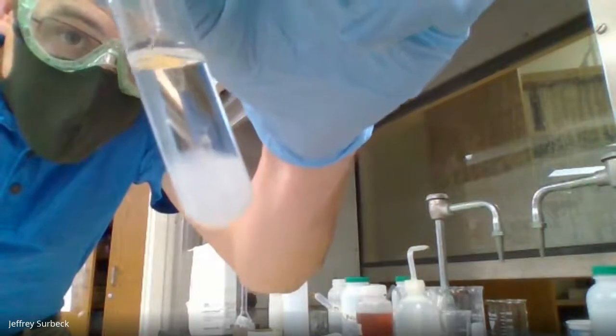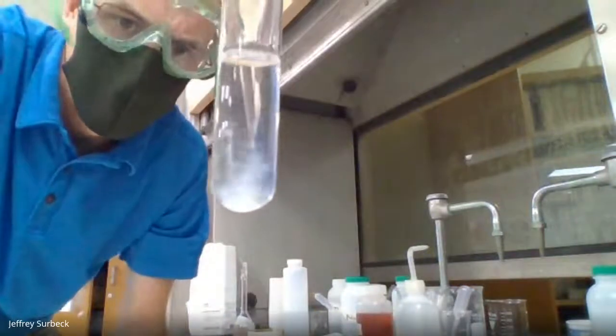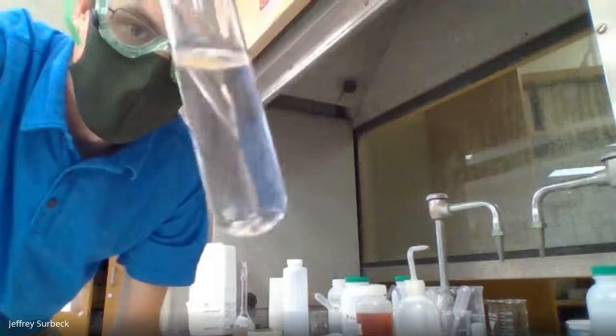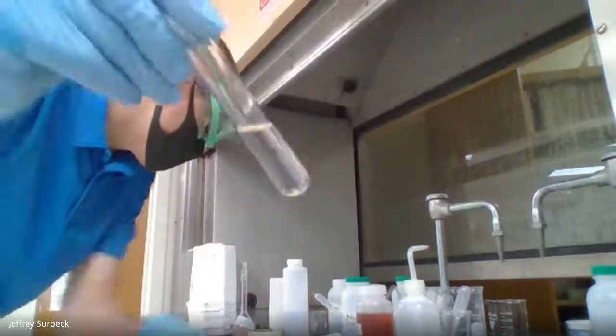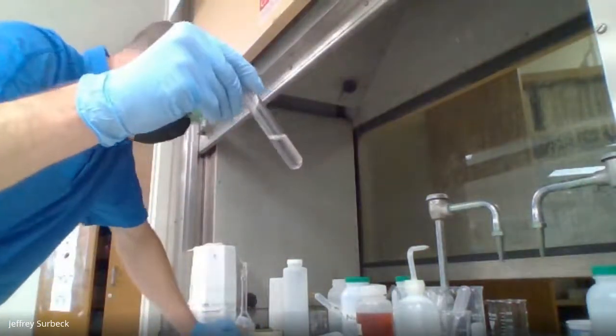Check out what's happening. Let me mix it up. Aha, look at that. The solid that was there is now gone, and we're back to a clear solution. All right? So this part right here, this clear solution, should go under number 14.